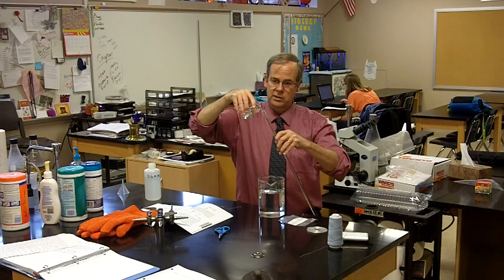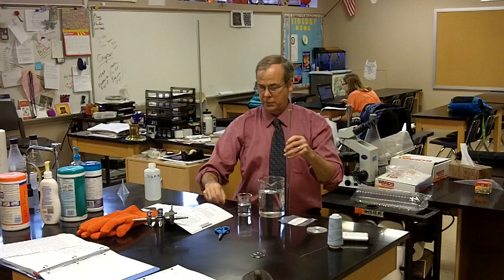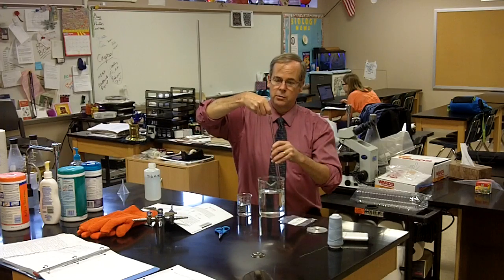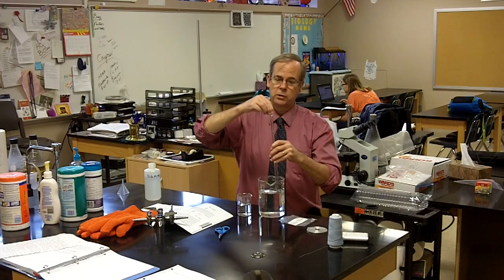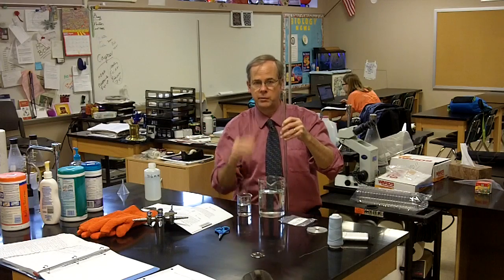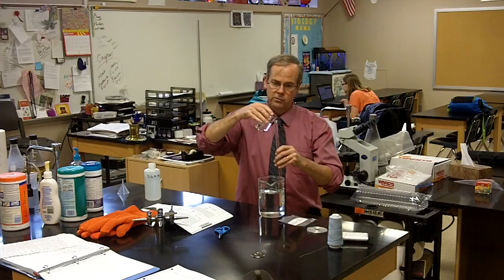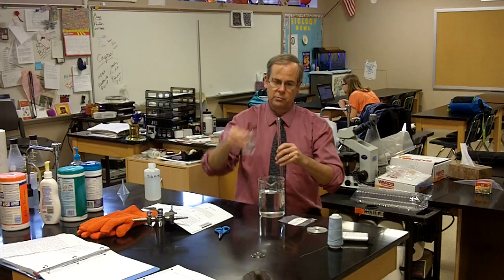And when it's entirely filled with water, I'll take my piece of magnesium and insert it into the tube. I make sure that the string holding the magnesium hangs outside the tube. That will anchor it to the bottom when I turn it upside down. And I once again make sure it's absolutely filled with water.